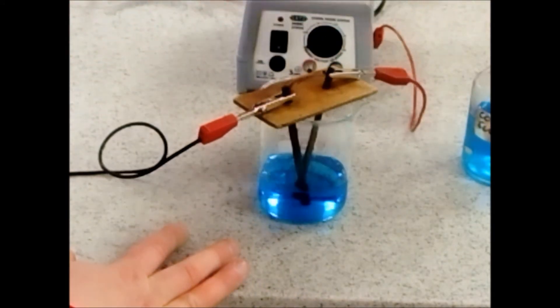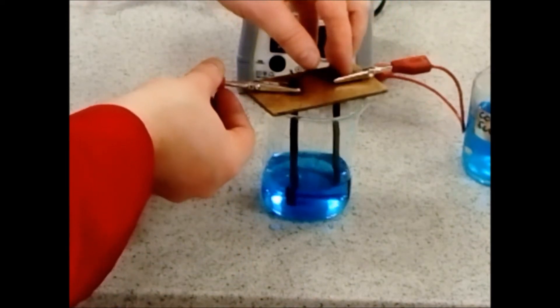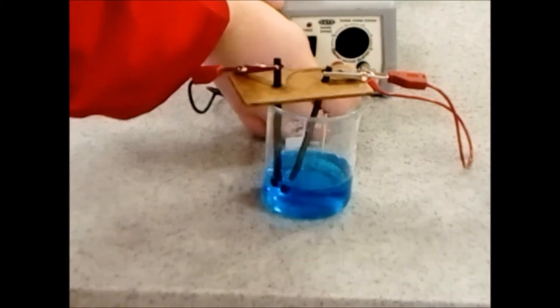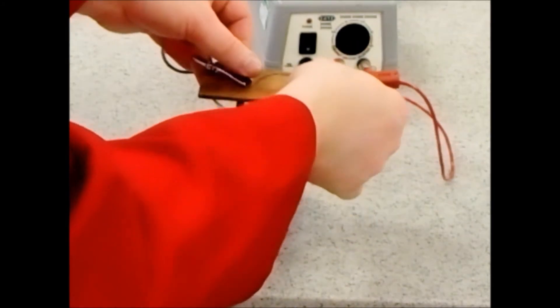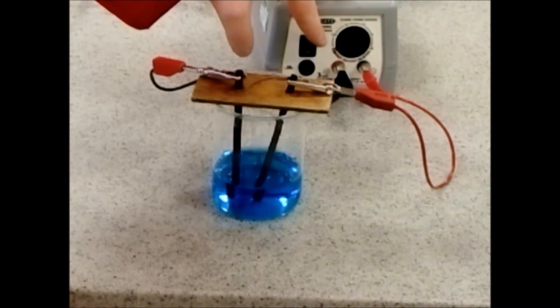Once they're in, arrange them so that they don't end up touching. If needed, put a little bit of sellotape or something on there just to hold it in place, or prop it up. Then plug it into your power pack. Once it's plugged in, always start on the low voltage, then turn it on and slowly turn the voltage up.